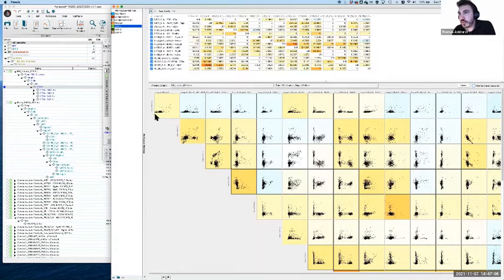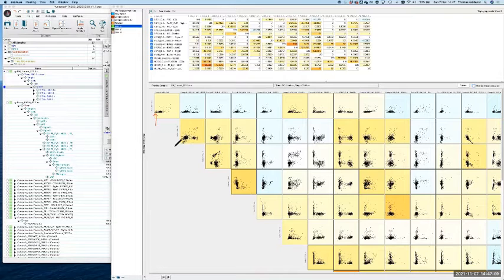Yeah. Well spotted. So that stuff there. Yeah. Cool. And people won't be able to see the numbers, but just so you understand, because it's a half matrix, the full matrix would include FITC versus PE and PE versus FITC, which is the same thing. So it just does the half matrix, but essentially this x-axis at the moment is the PerCP-Cy5.5 detector, and that switches over here to the y-axis. So this is FITC versus PE, PerCP-Cy5.5. This is APC versus PerCP-Cy5.5. AF700, et cetera, et cetera. It gets a bit weird to do the mental geometry to flip the plot, because you go from here to here. But anyway, it's just a thing to point out.